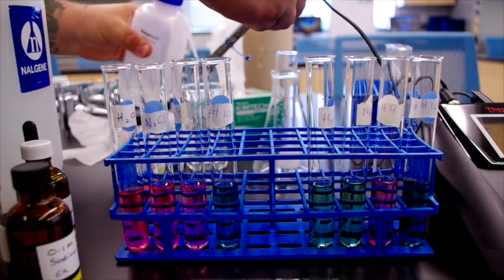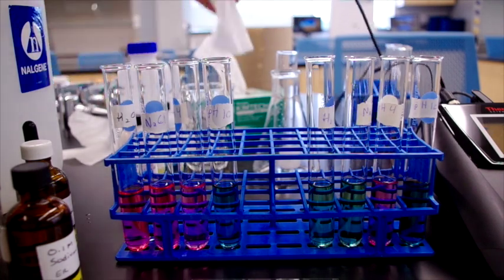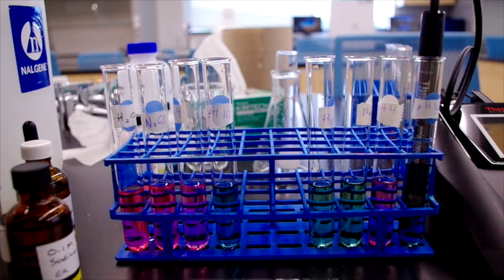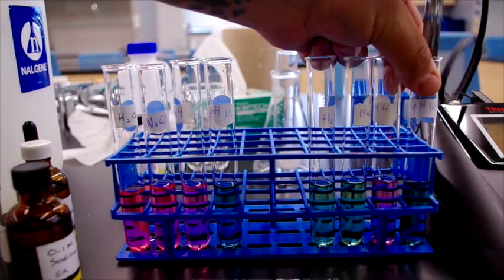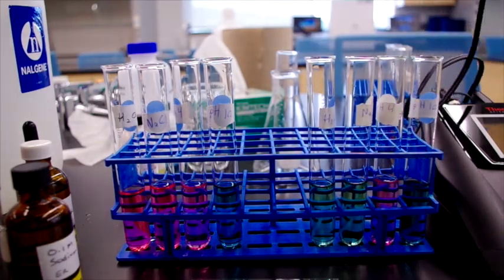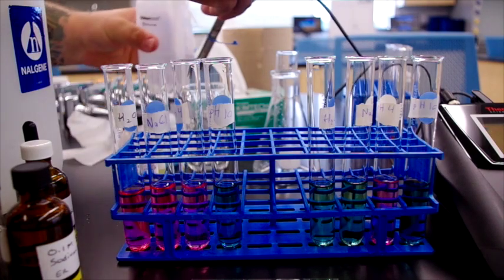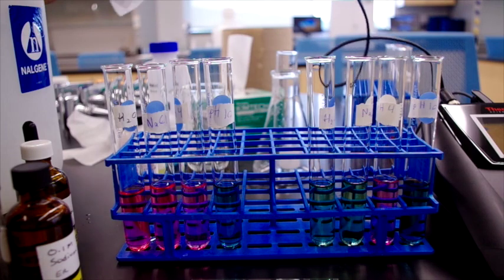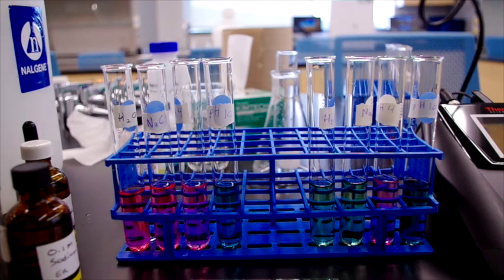And finally, our pH 10 buffer has also resisted increasing its pH and is hovering around 10.3. So that is buffers. You will be asked in your lab report to explain why this phenomenon occurs and to make observations based on these experiments.